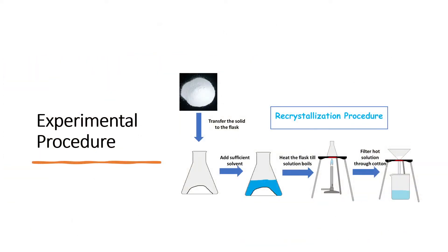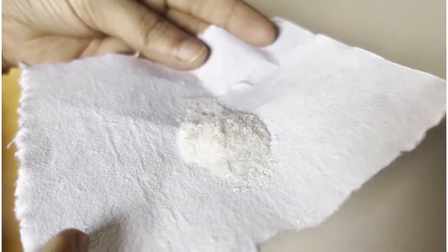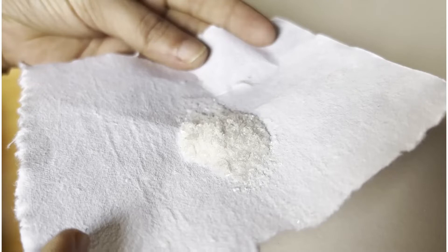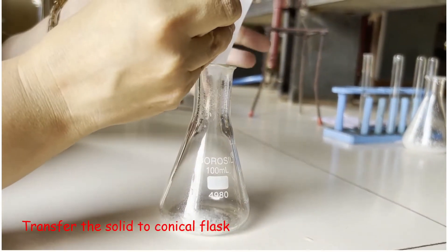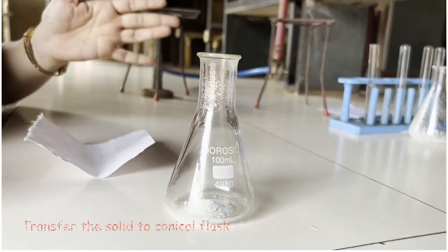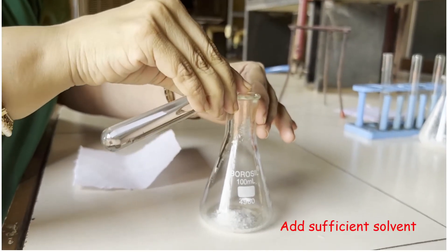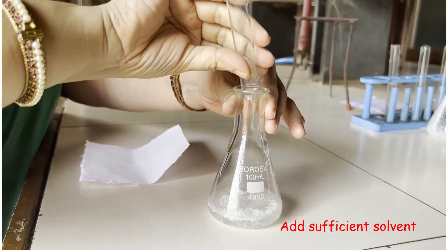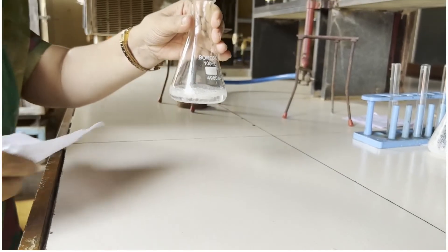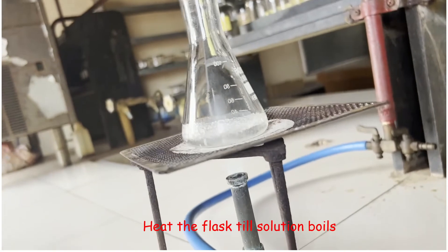Now we will see the recrystallization procedure. This is a crude compound which we want to purify. We have to transfer this to a conical flask, then add a sufficient amount of solvent — 15 to 20 ml. I am using water in this case. We will keep this flask on wire gauze for heating the solution.